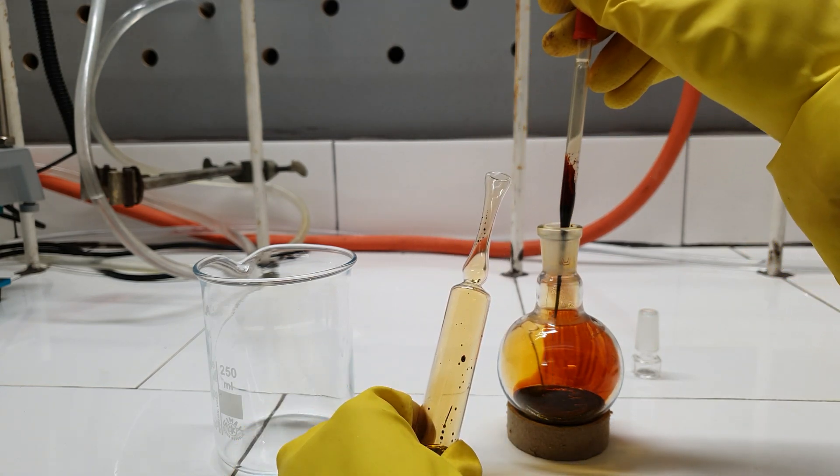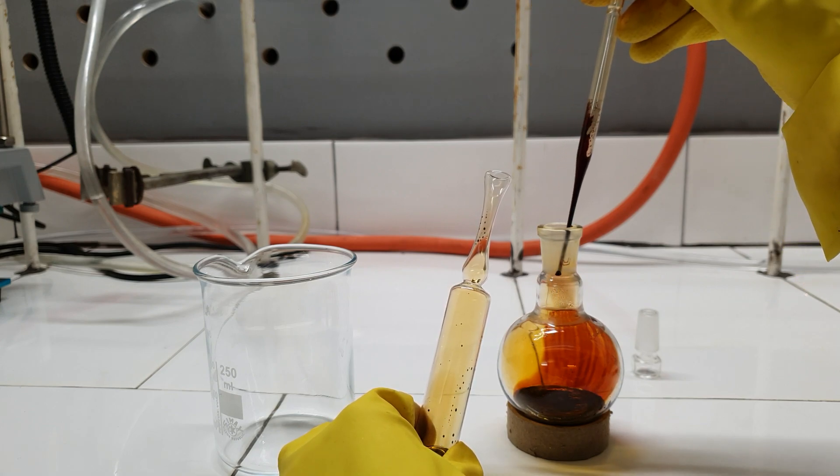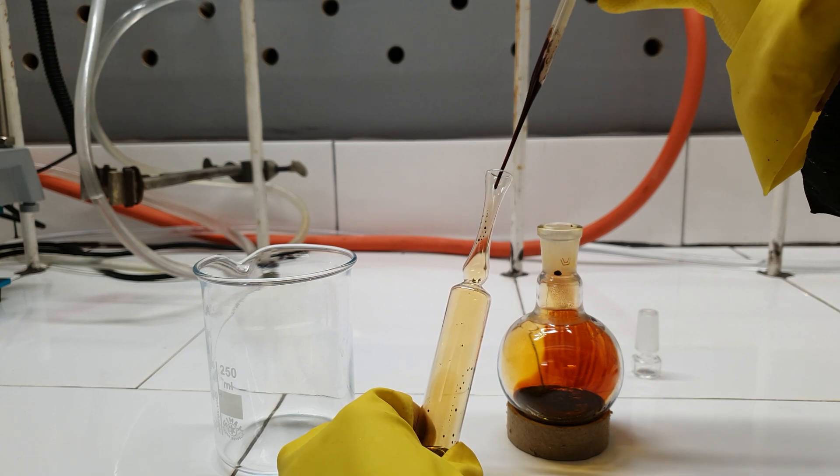At one point, even with this preheating step, the iodine monochloride started to solidify in the flask, so I had to melt it again.